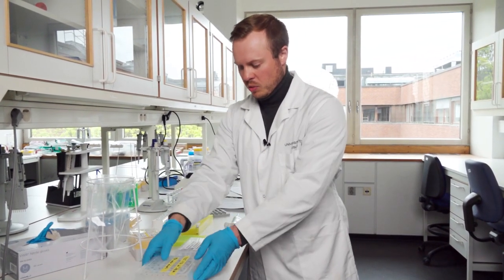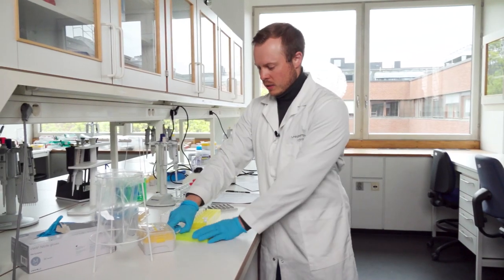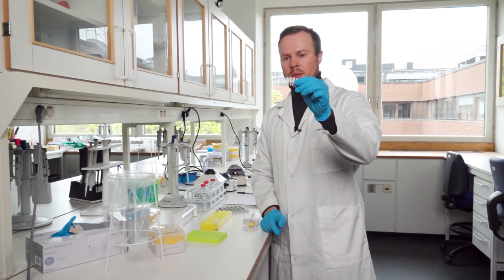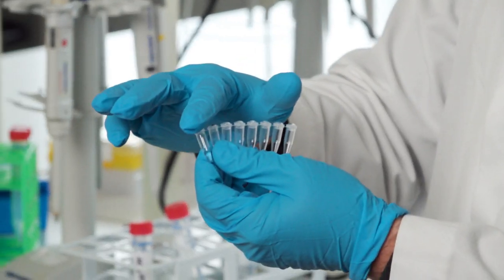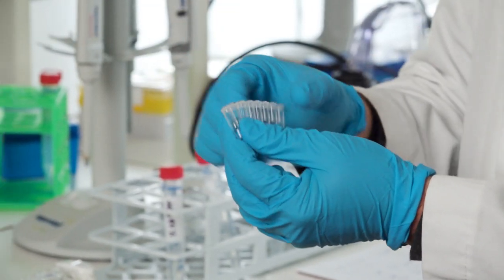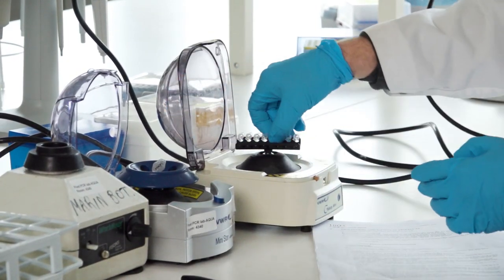The beads need to be kept cool, so place them back in the refrigerator. For our PCR products, I strongly recommend spinning them down once before opening, because a lot of product can be at the top of the tubes after freezing. If you open without spinning, you risk contaminating your fingers and causing contamination. So always spin tubes down first.